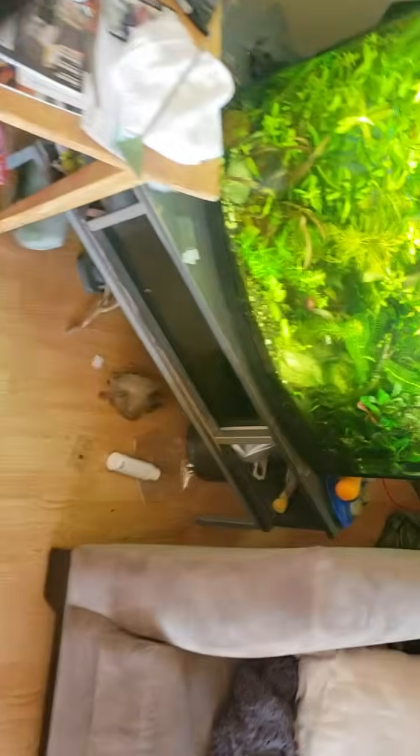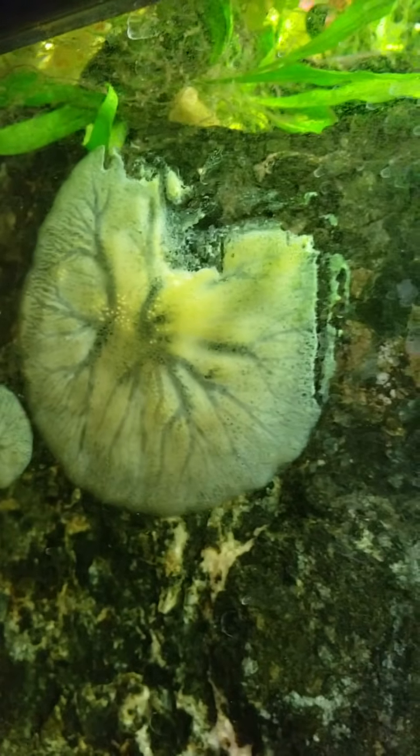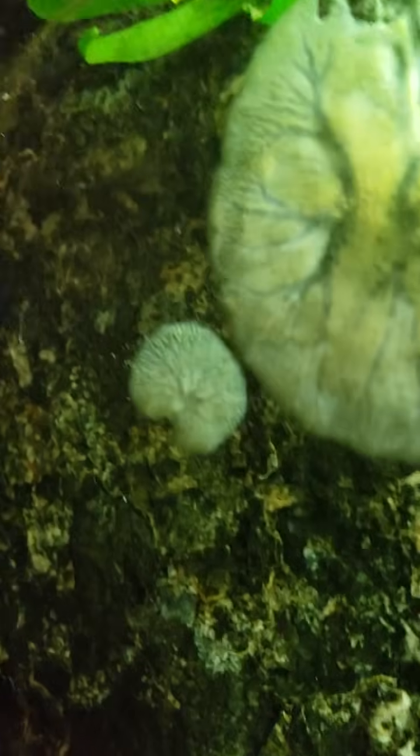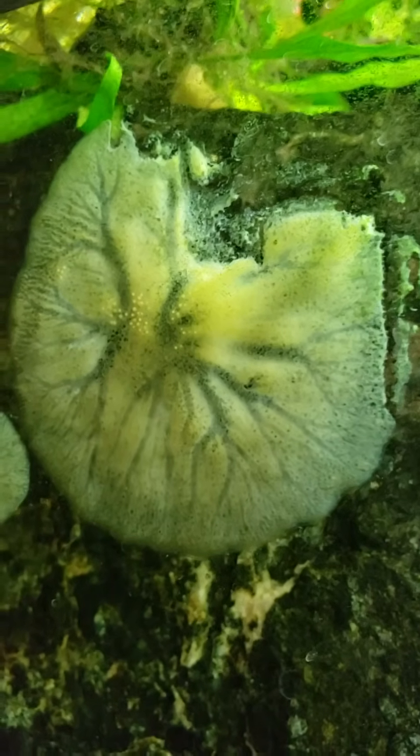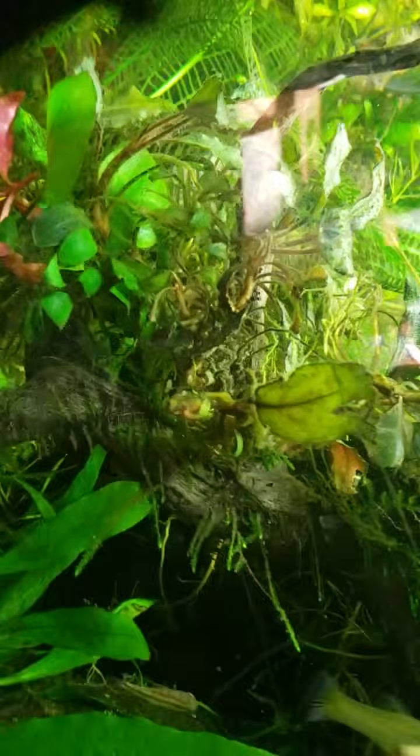I'll show you one last time the sponge. So I feel bad. Look at what we've done to this poor guy. I've sent out samples and all sorts of stuff. But there's the sponge growing down here. There's this little buddy here. And then there's this main sponge that I accidentally butchered. I didn't mean to butcher it, but I slipped when I was taking a notch out, and it all peeled off. Some of it fell down below into the snail graveyard where the puffers eat, and some of it just kind of melted away over the next day.